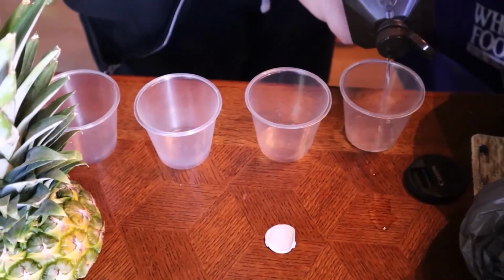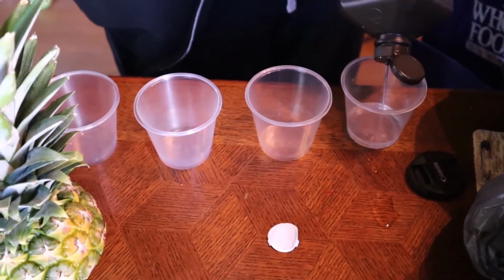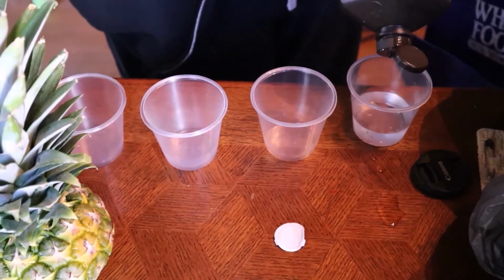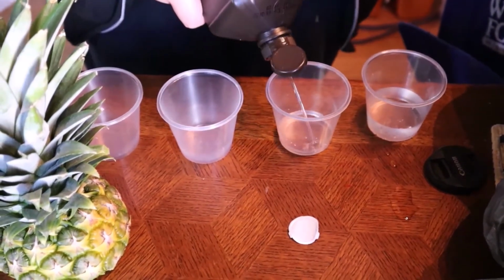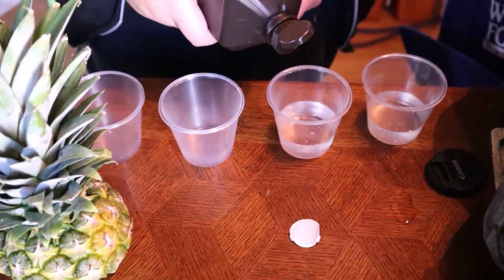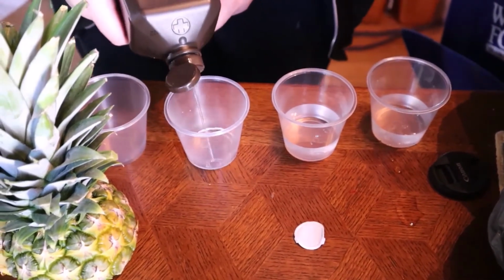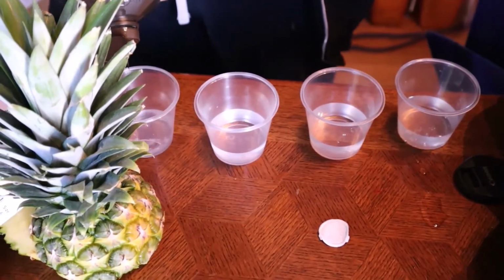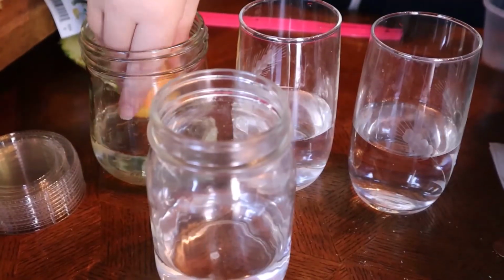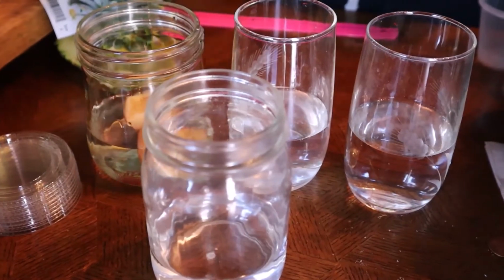You are going to pour 2 inches of hydrogen peroxide into each of your 4 containers. We poured ours into the cups and then measured it. We found we were way off in our measurement and had to adjust to larger cups. You notice that we have 3 food items and 4 cups. You will not be placing anything additional into the 4th cup, as this will be your control group.